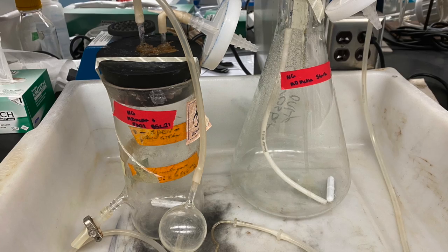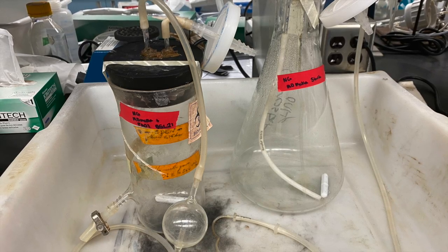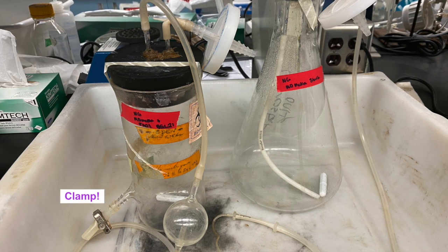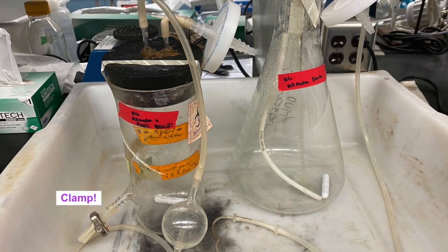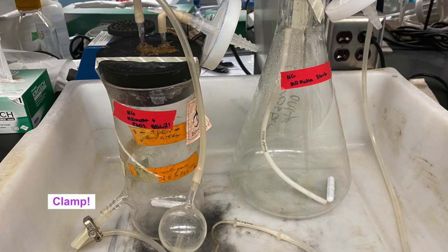After the chemostat has been rinsed, it will be autoclaved. The chemostat equipment will be autoclaved fully assembled. All parafilm around the tubing and around the lids will be removed. Parafilm cannot withstand the heat in the autoclave and will melt. Before autoclaving, a clamp will be placed on the growth chamber to prevent an influx of air entering the chemostat after we have removed it from the autoclave.